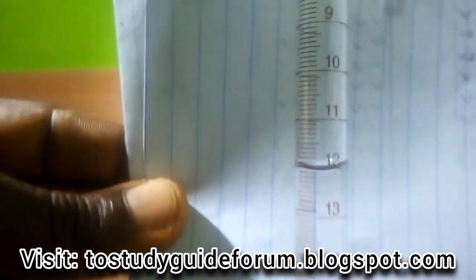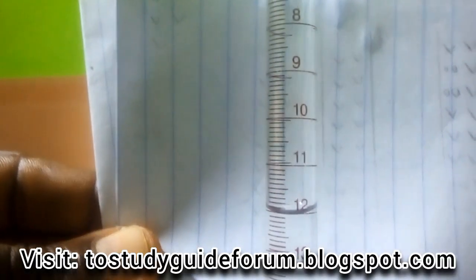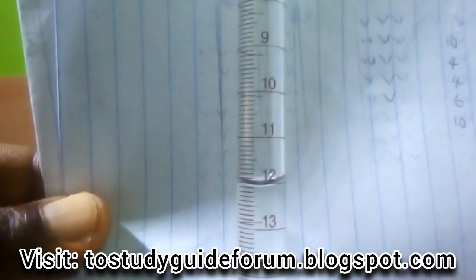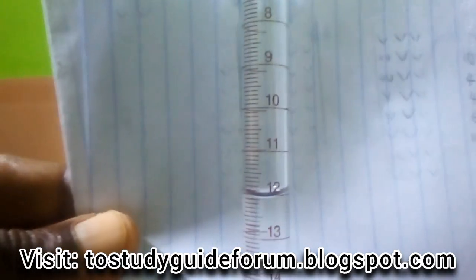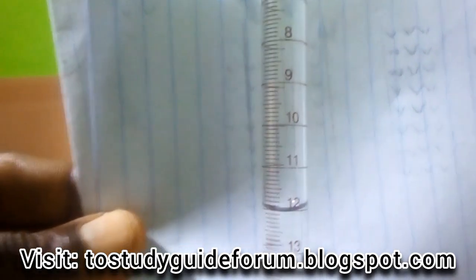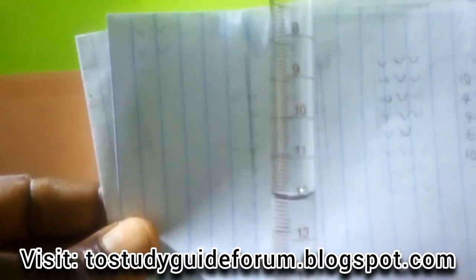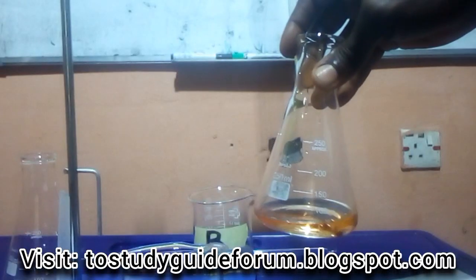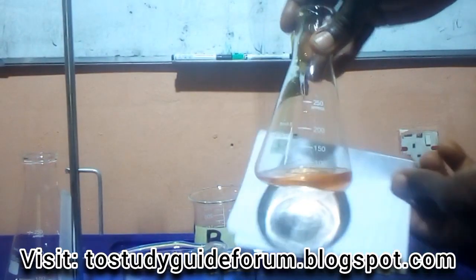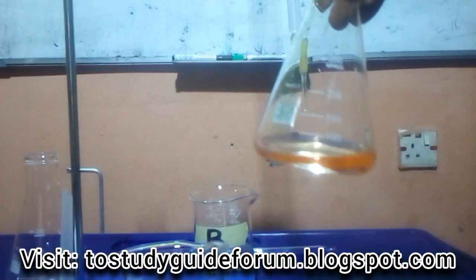You can see, this is okay now. That's 12.1. Now it has 12.1. So this is the reading, that is 12.1. Then we're going to do another titration. Alright, that's the color, the orange color of our titration. So we're going to be doing another one.